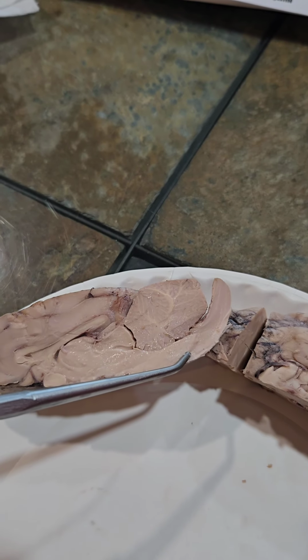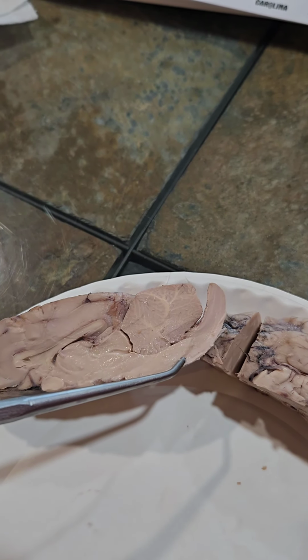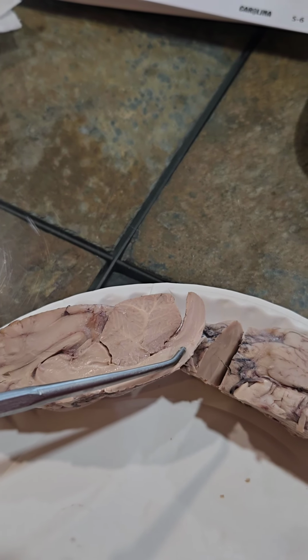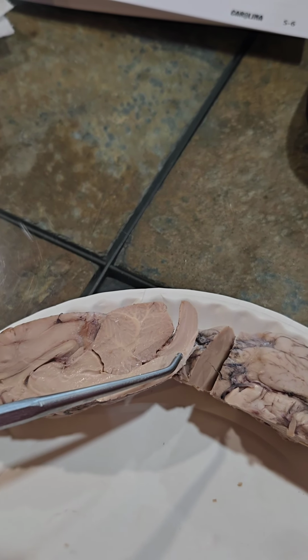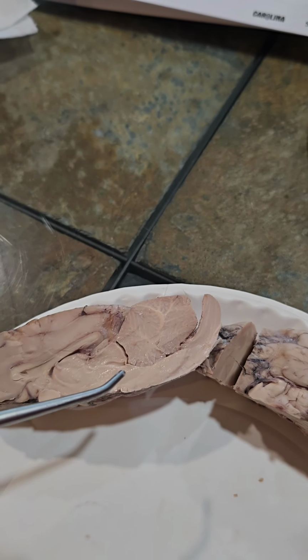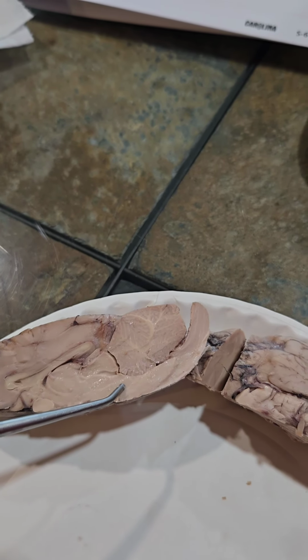The pons contains nerves that connect the cerebellum with other parts of the brain and spinal cord. The medulla, inferior to that, is the most inferior part of the brainstem. It contains centers for heart rate, blood pressure, and respiration. The midbrain is the part of the brain between the pons and the diencephalon.